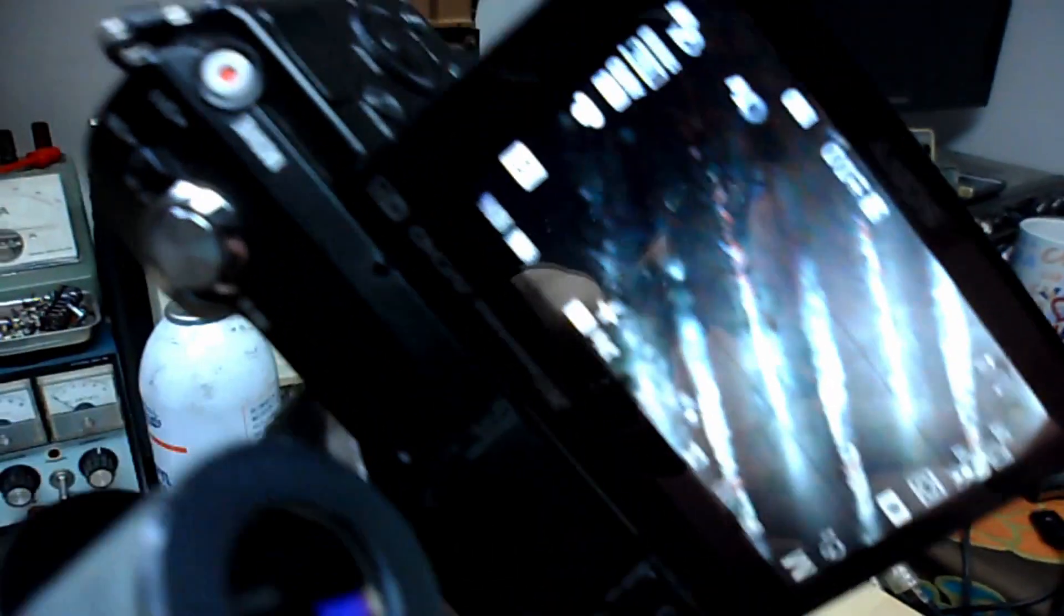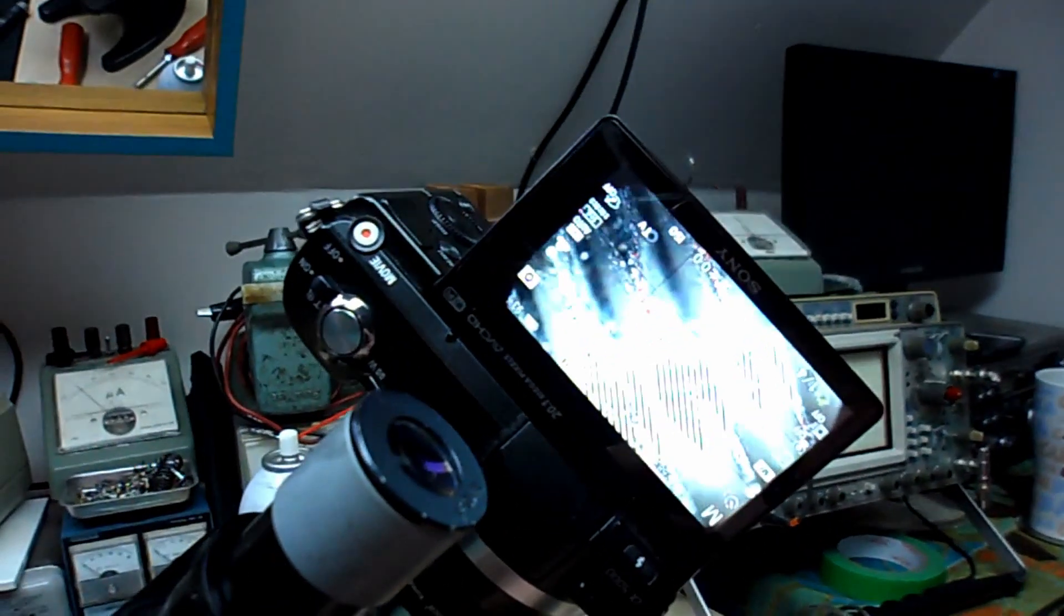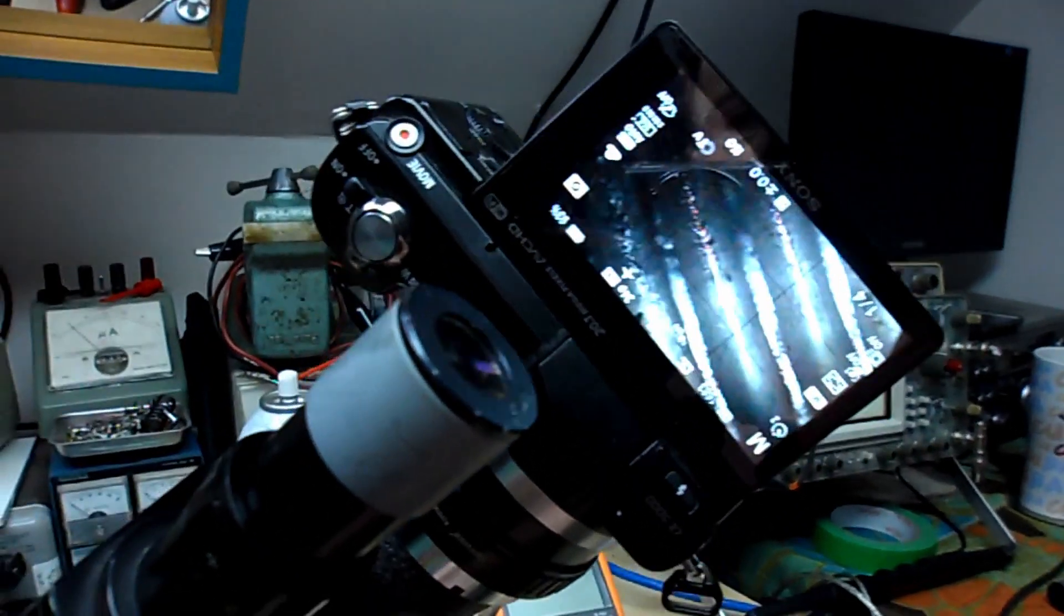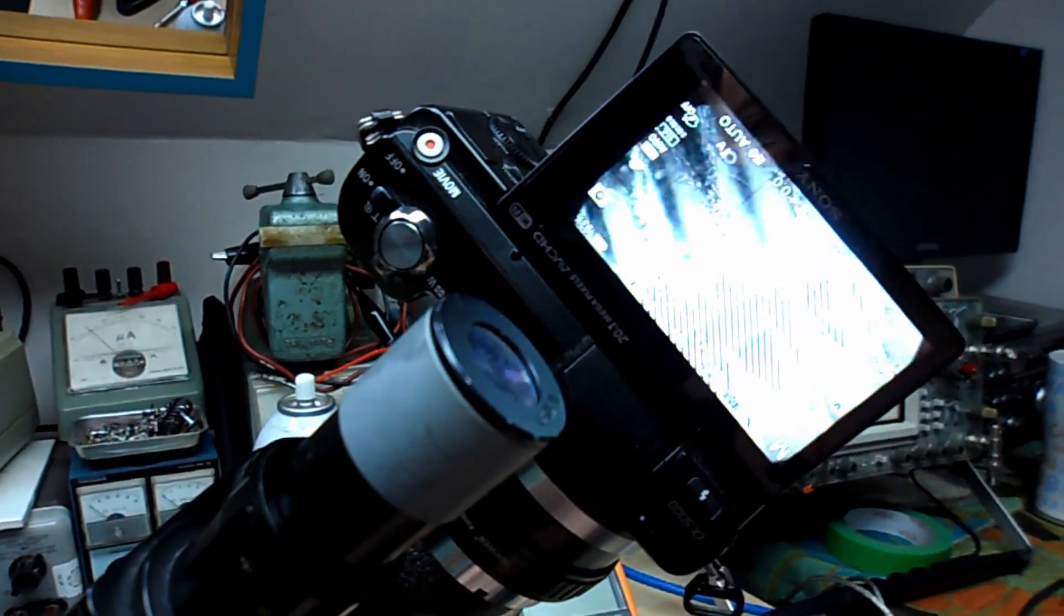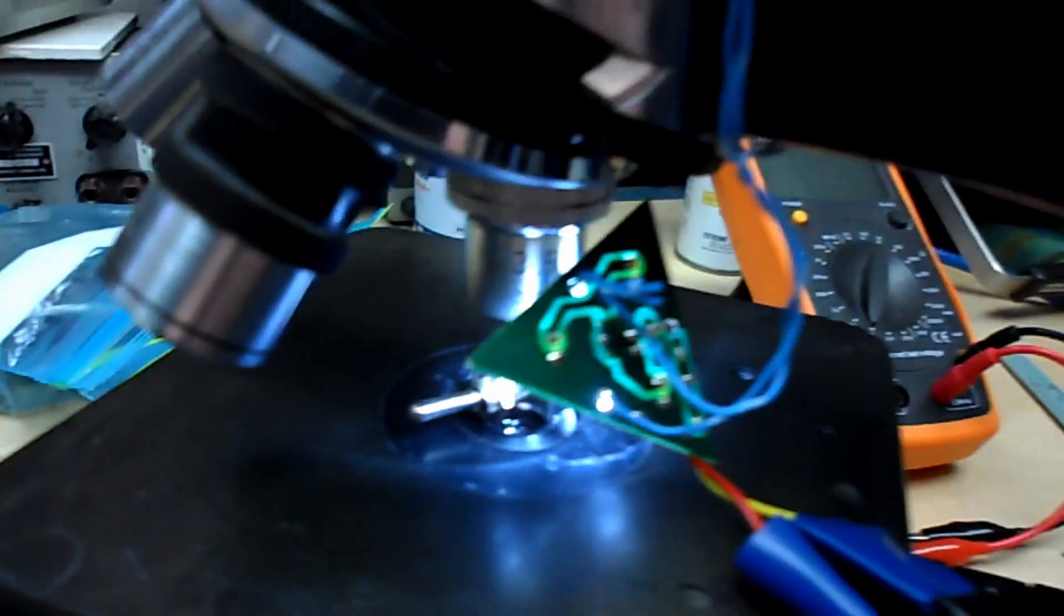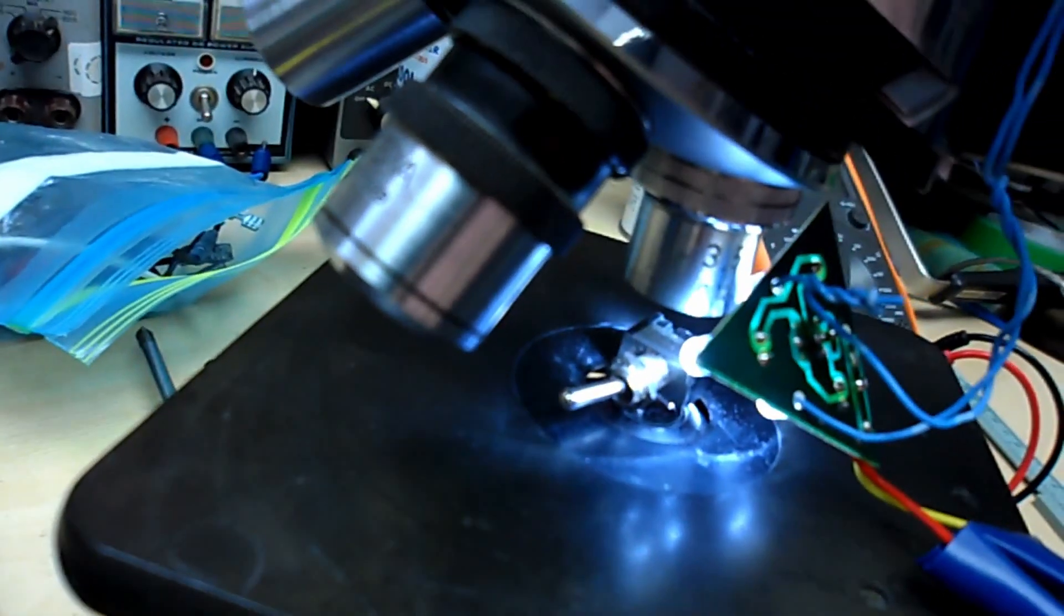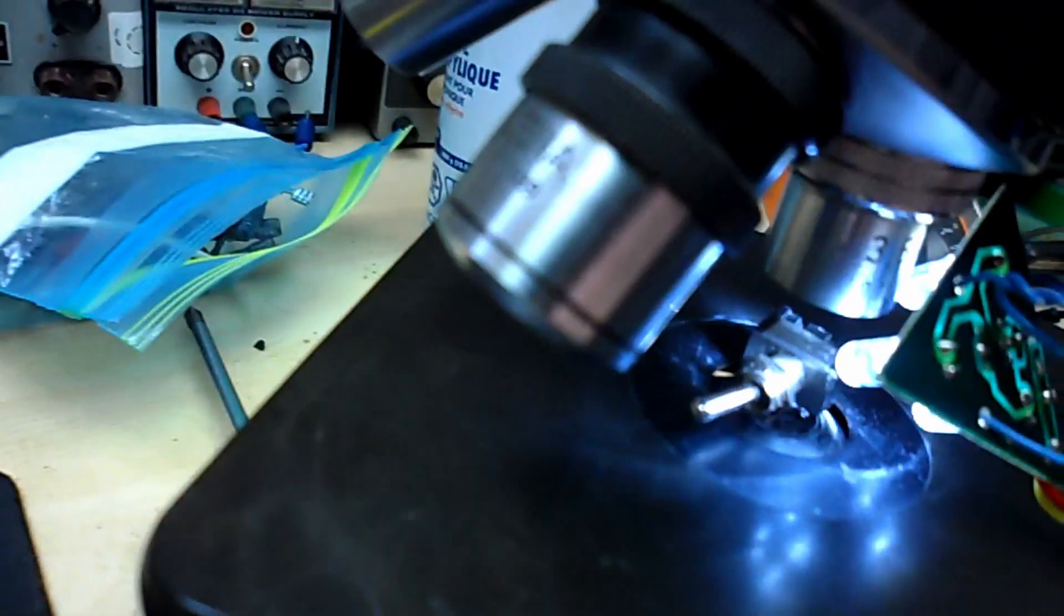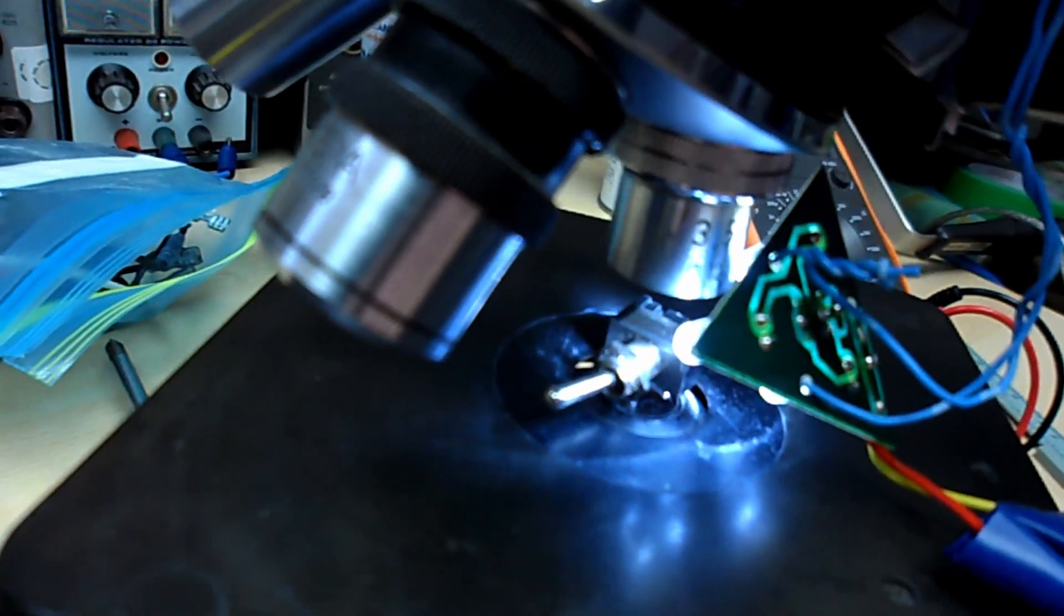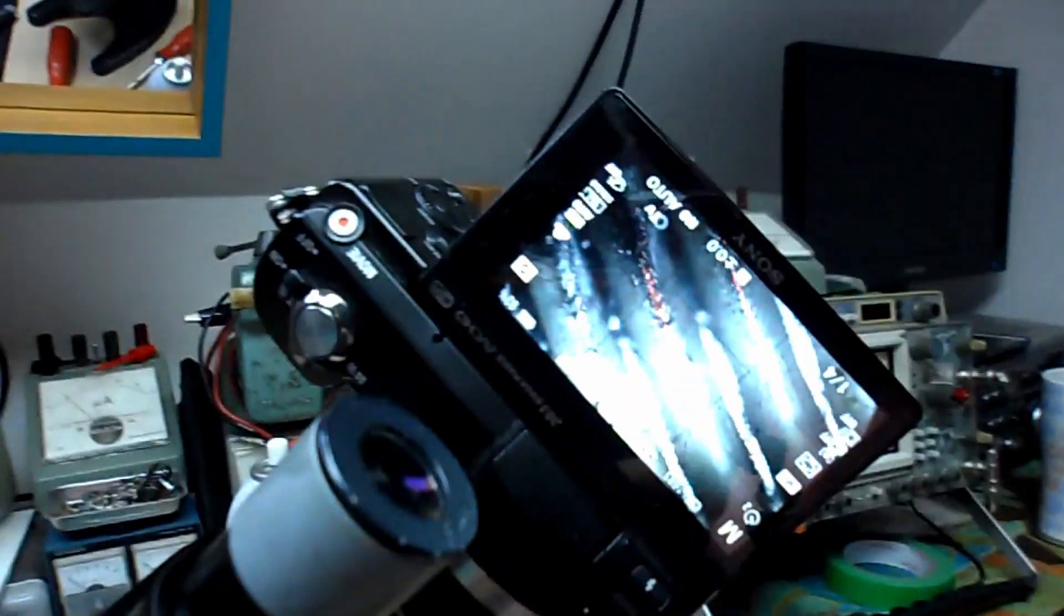The lighting is the trick, right? So as I move the lighting around you see what happens here. It's pivotal. This is not really the best but it's better than nothing for the moment. I'll come up with something better I hope at some point in time.